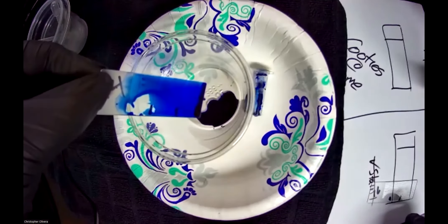Now we're going to set up for lab 16 — this is going to be a little more complex. You can see it looks like it's dried off with that little film on it — that's how you know it's air dried and heat fixed. Alright, so let's do our last step. The breakdown for the gram stain is: one minute, one minute, three seconds, one minute. Here are all my stain steps. I'm going to take crystal violet — that's the '16-1' — pop it open, same idea, let it sit there.